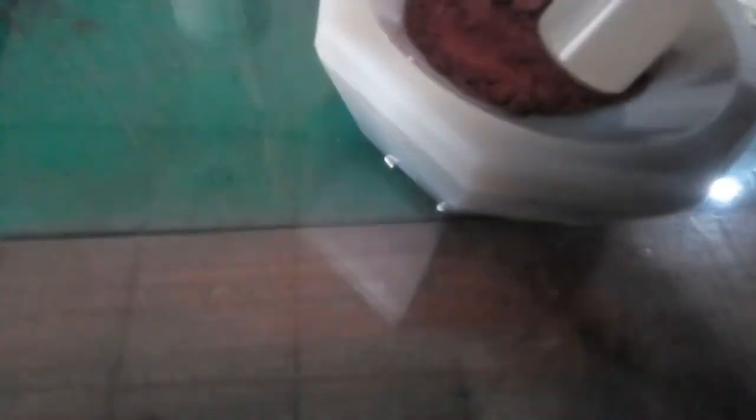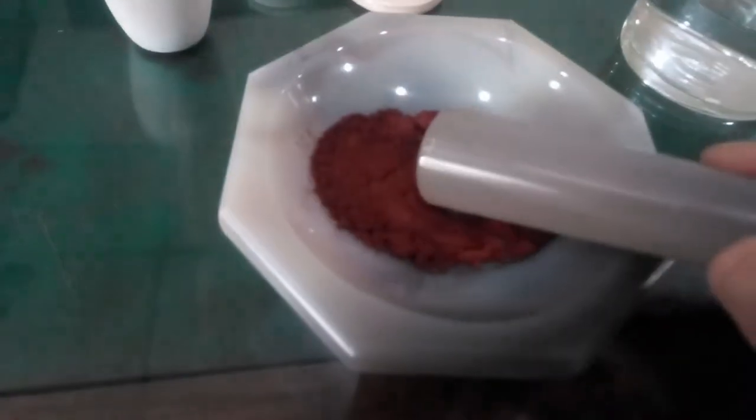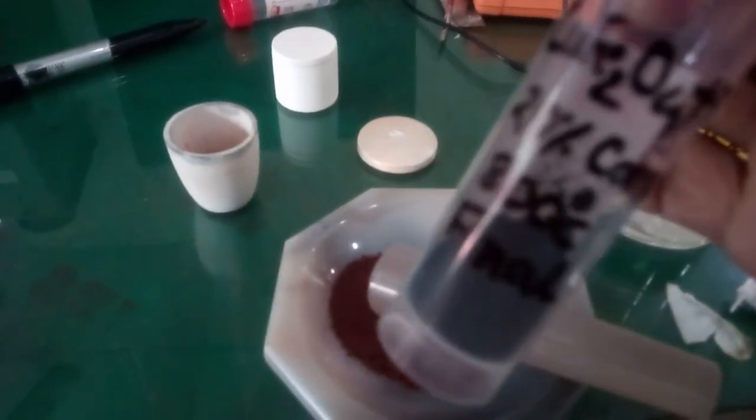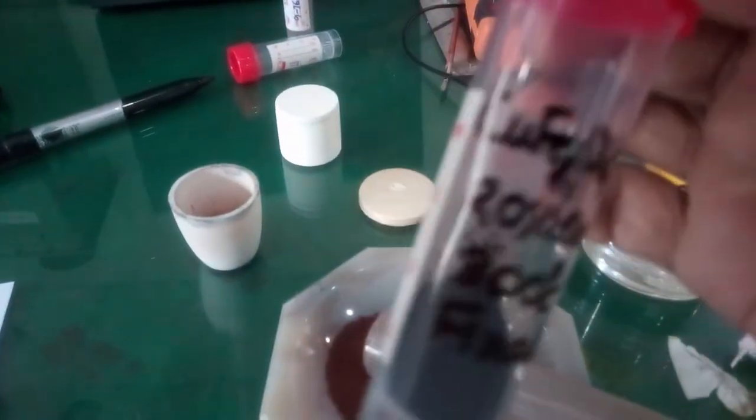Then using it, you can grind it properly. And after grinding it properly, this is the sample container.